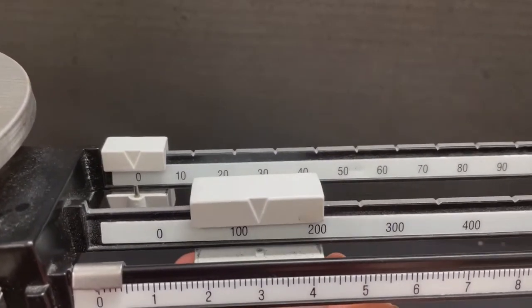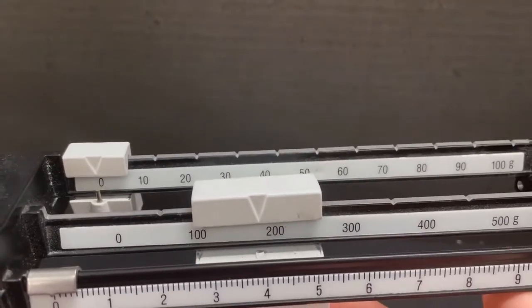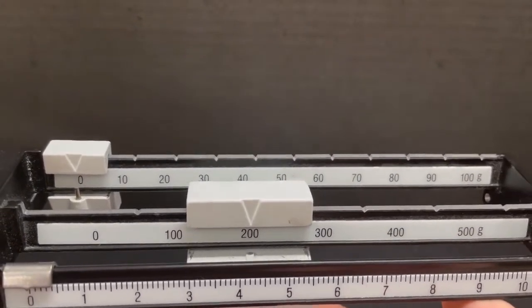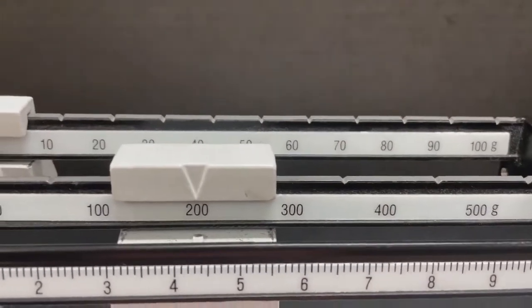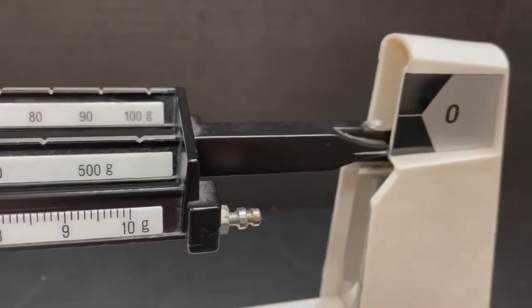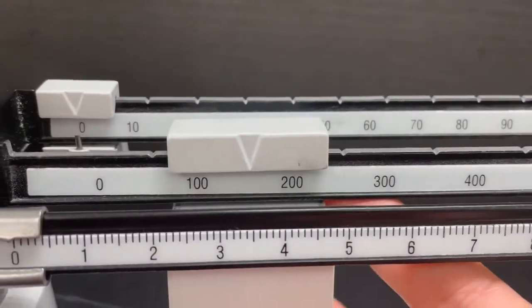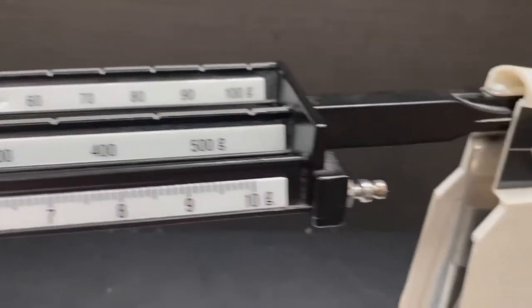You want to move the weight along the beam until you hear it click. It clicked, and it's at the 200. It's pointing downwards. As you can see, it's too much weight. What we're going to do is take it back to the 100 and see if that worked.